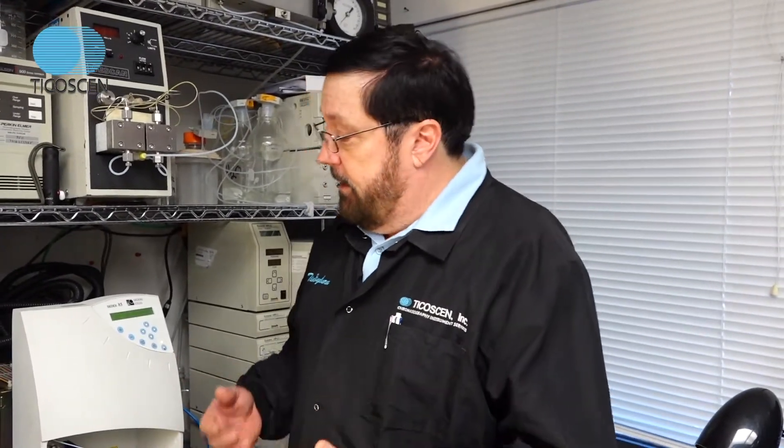If you're running gooey, sticky, gummy stuff, you want to do this more frequently, just like your car. If it gets dirty all the time, you got to clean it more often.